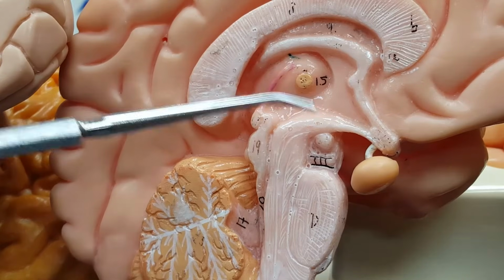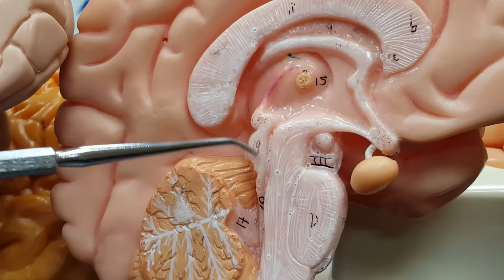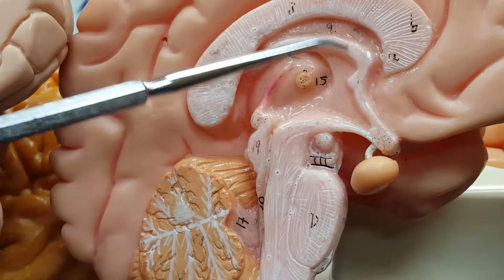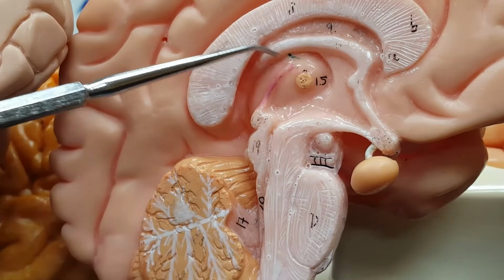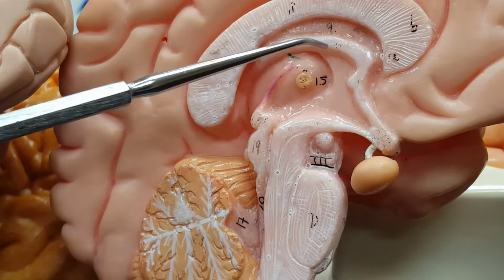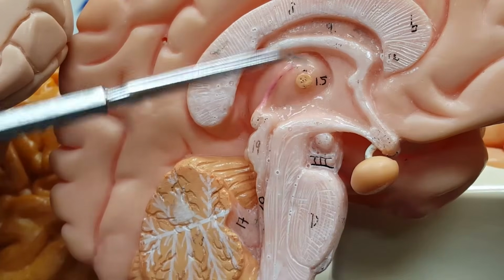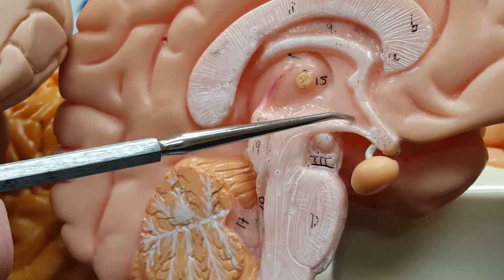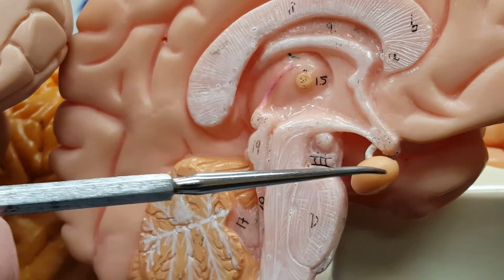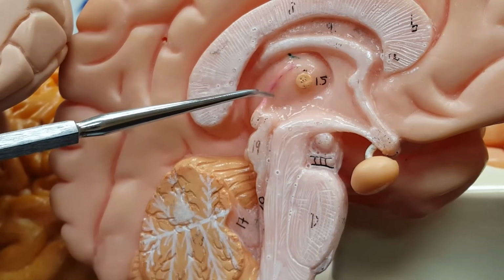Now, as long as I'm here, so see the top edge of the midbrain right here, corpora quadrigemina, right there. And then as I work my way up, see this thing right here, this white line? This is called the fornix. That's the roof of this thalamus. So thalamus, hypothalamus, right there at the tip of my pointer, infundibulum, pituitary gland, intermediate mass, pineal gland.